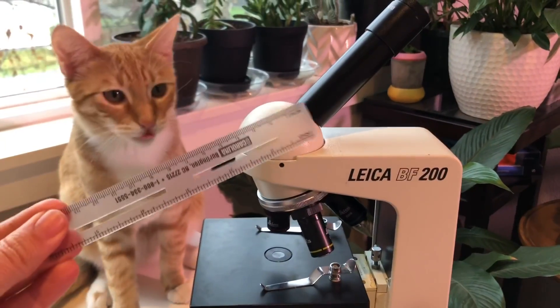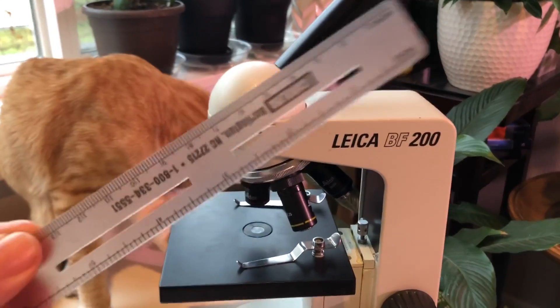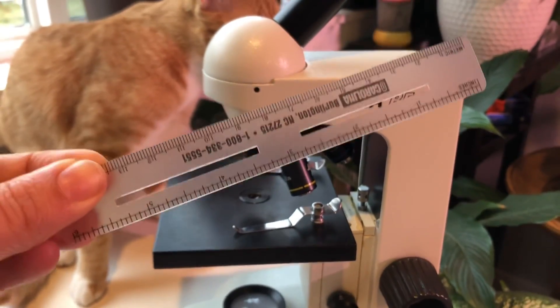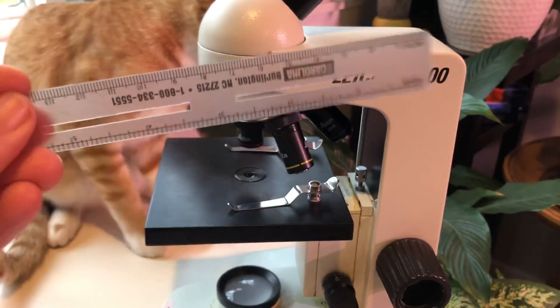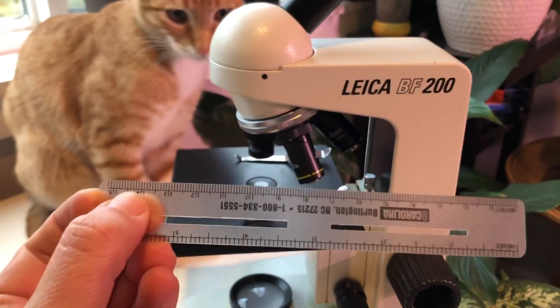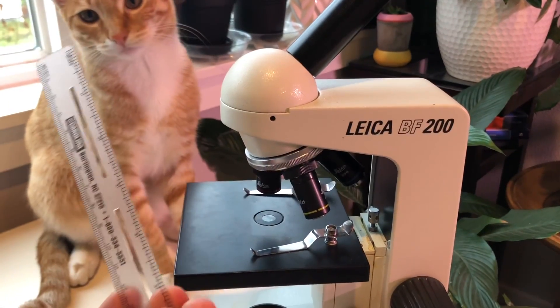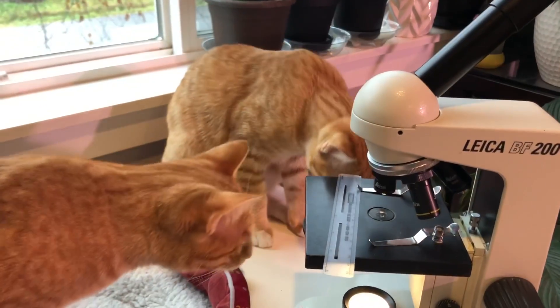I'm going to use my ruler — this is a transparent ruler so I can see through it when I put it under the microscope. This ruler has millimeter measurements, so we always want to use the metric ruler side, not the English inches. We want the metric ruler side.